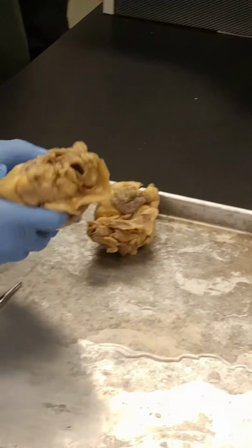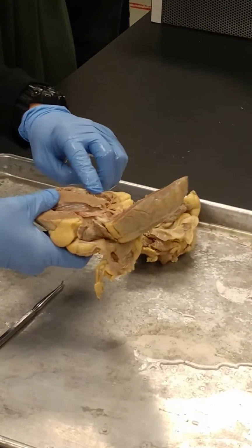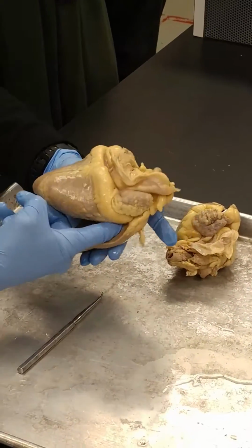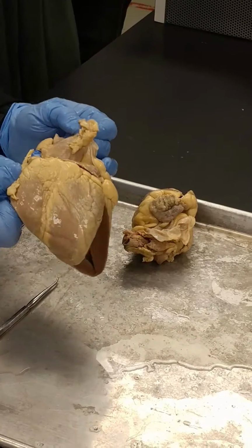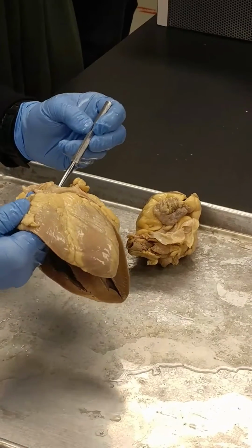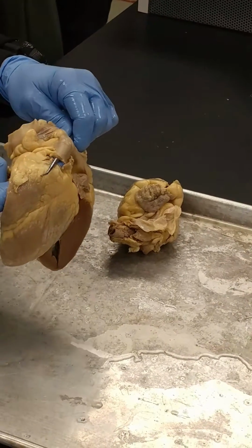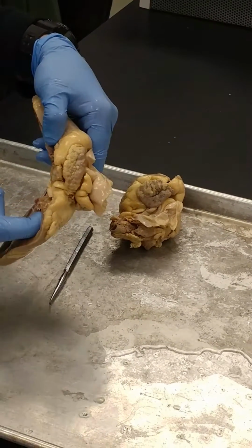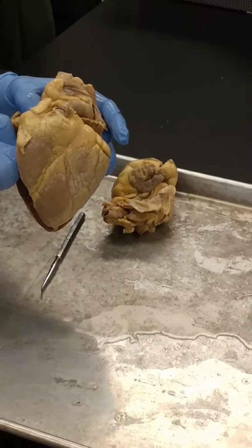I don't know if this one has it, and if it doesn't, that's okay, because what I want to do, so remember, this is the right side, left side. I flip it over, so the right is on the right, and I stick my finger up in here, and eventually I'll be able to get through to the pulmonary trunk. They did cut this, but this is the pulmonary trunk, this vessel right here. Okay? So if you have a question, you want to find out what you're looking at, as I said before, right atrium on this side, go up in there, and that's where, or right ventricle on this side, go up in there, and that's where the pulmonary trunk is.